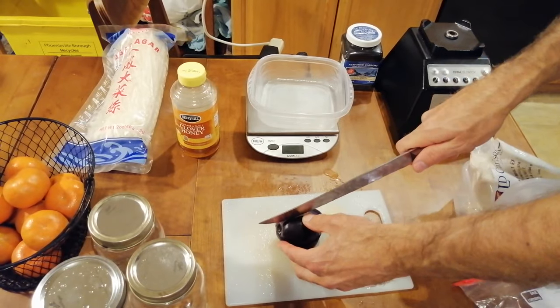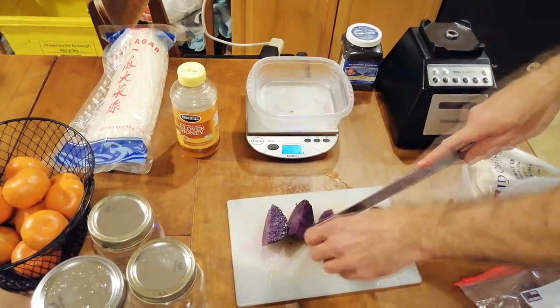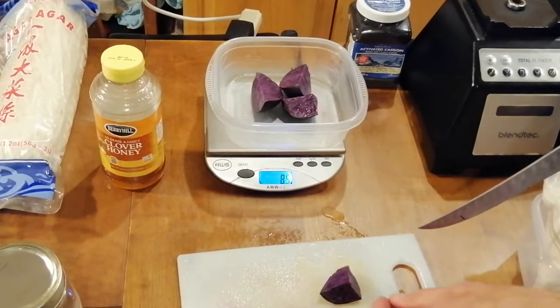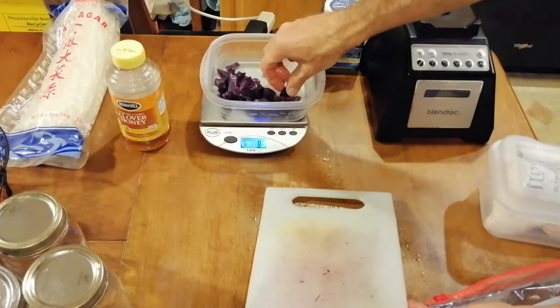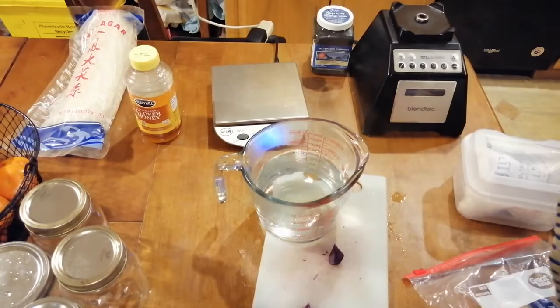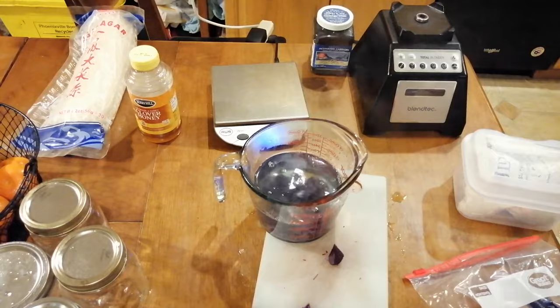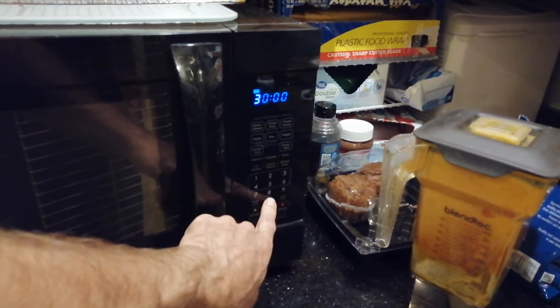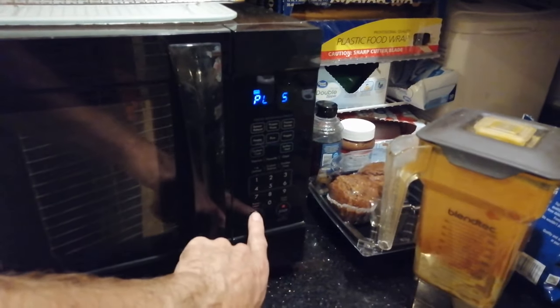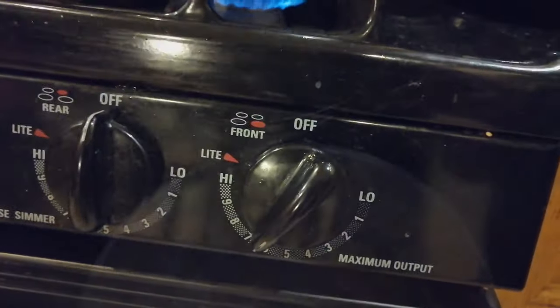While that's boiling, we'll do the same preparation with the purple potato — just to compare and see if there's any difference or advantage to using different types of potato. We're looking for about 80 grams of potato, so we dice that all up and weigh it out to get exactly 80 grams. Add the 80 grams of potato cubes to some hot water. For this one I'm going to try doing the cooking in a microwave oven at power level five, cycling between heating and not heating every 15 seconds to prevent the water from boiling over. The water levels were looking a little low so I added a bit more water to the boiling sweet potatoes.